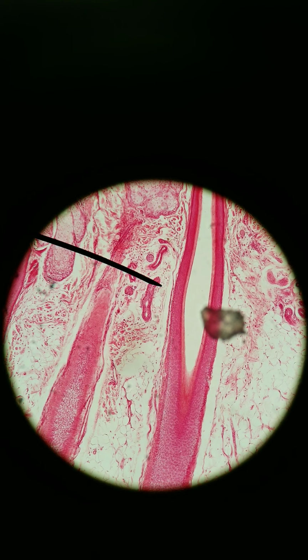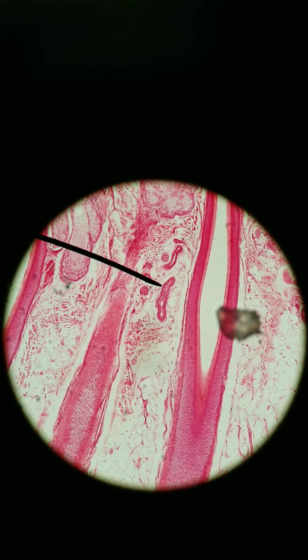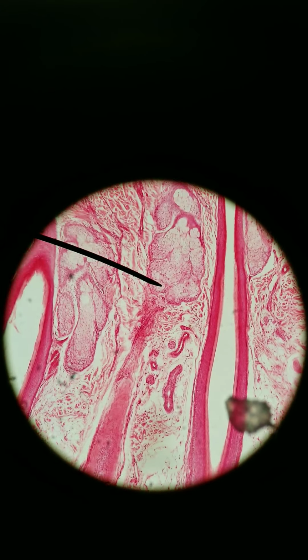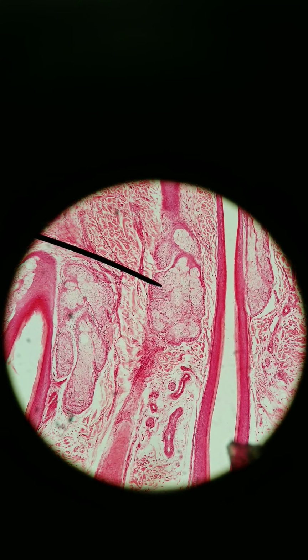release excess salts. So in thin skin that's found on the scalp, we can find hair, we can find eccrine sudoriferous, and we can find sebaceous glands. In thin skin from other areas, specifically from the axillary region or the pubic region, we can find one additional gland. Once I find it, there we go.